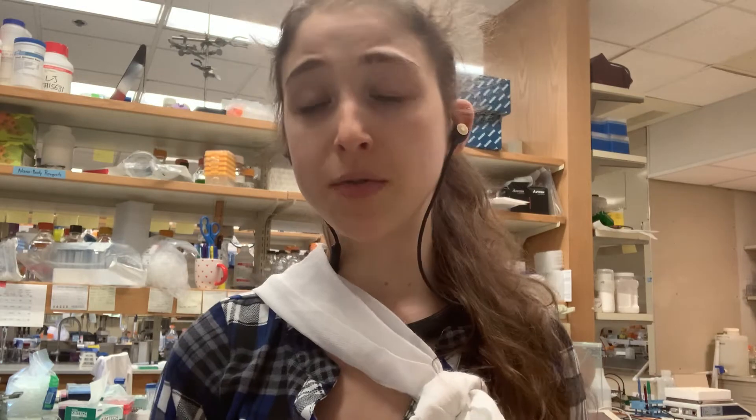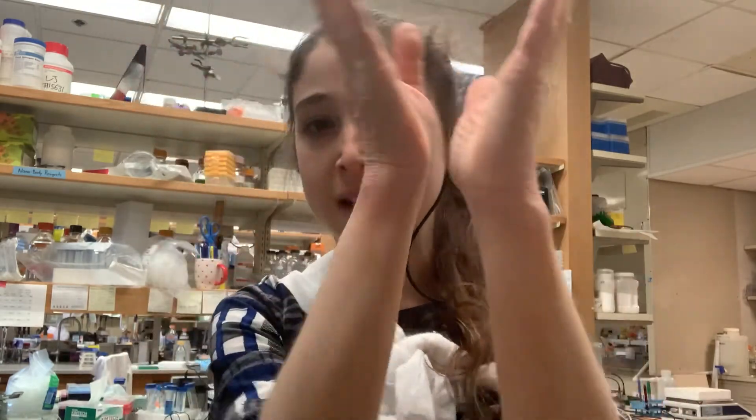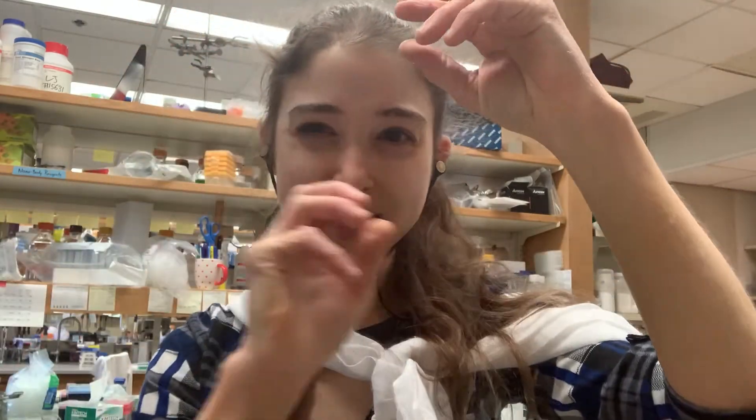We can manipulate the size of this mesh by using a higher percentage of agarose to separate really tiny things, and a lower concentration to separate really big things. The agarose gel is the separating medium — we use it because it's inert and boring, so the DNA just travels through it. DNA can only move through tunnel-like paths through the gel, giving it this slithery, snake-like motion — which is why we call it reptation.